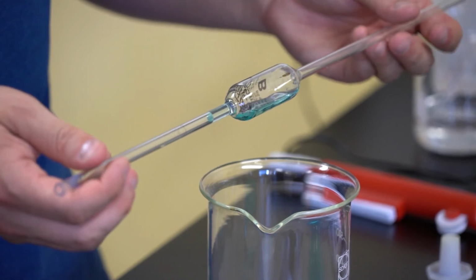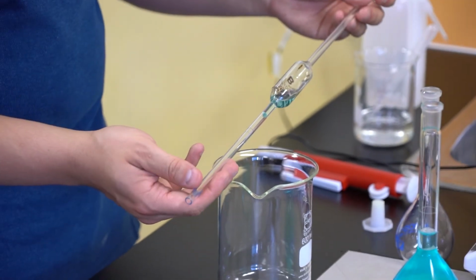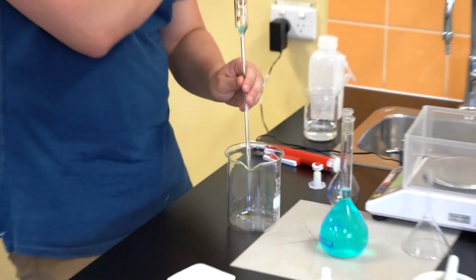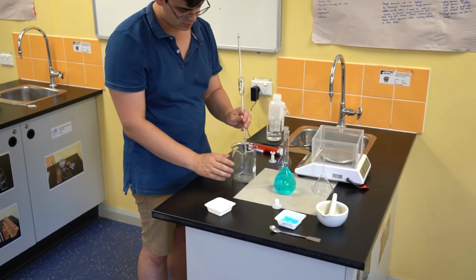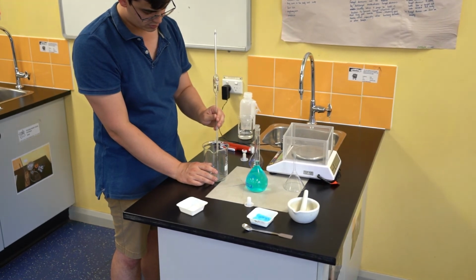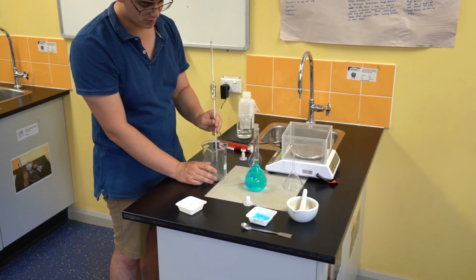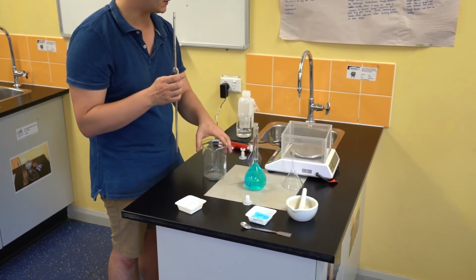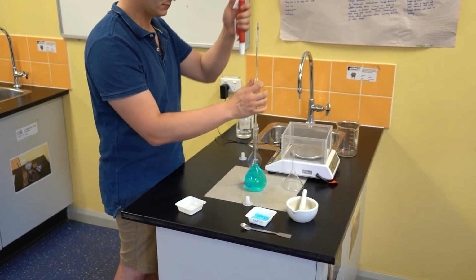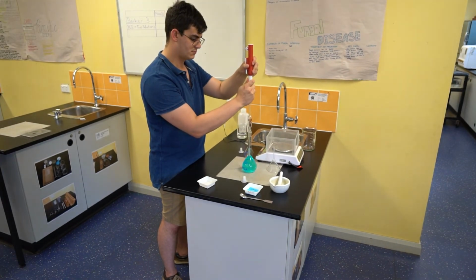I'm then going to tilt the pipette, trying to get some of the liquid into the top part of the pipette. You'll notice that I catch the liquid with my thumb before it exits out the top. Generally speaking, we don't want any liquid coming out the top of the pipette, as that can get into the pipette filler and cause damage. So once I've caught it, I can then turn it back the right way up, making sure that the end of the pipette is in my waste beaker, and release my thumb to release that liquid. Generally, we would complete this rinsing step in triplicate, but for the sake of an efficient video, I'm not going to be doing that today.